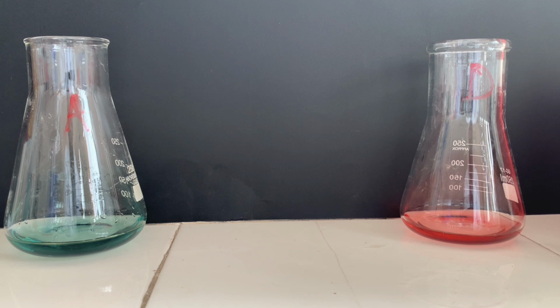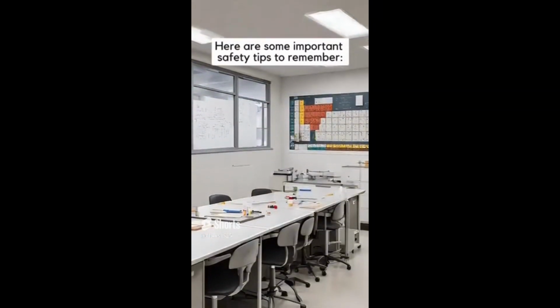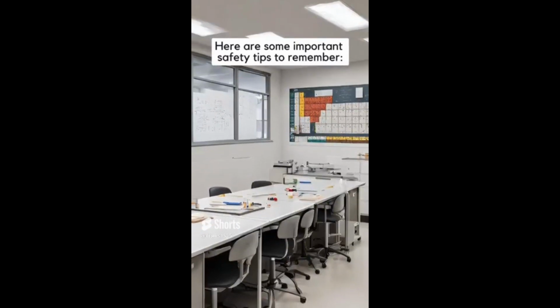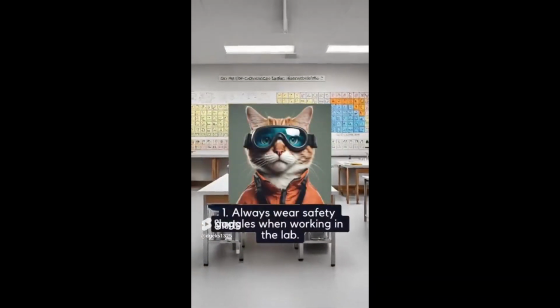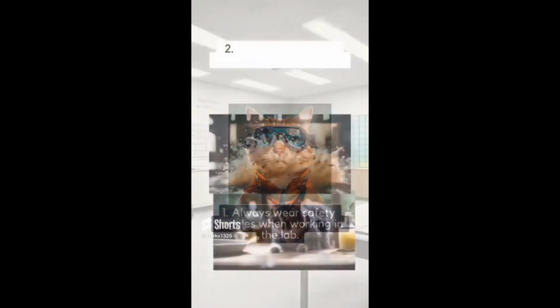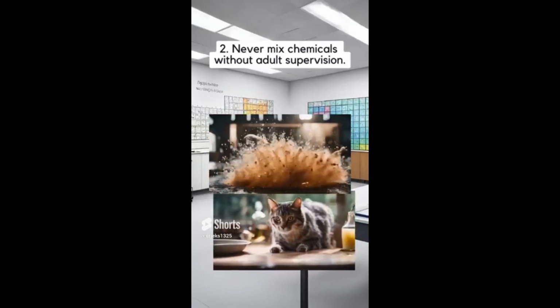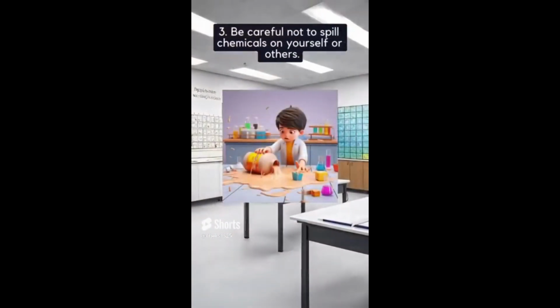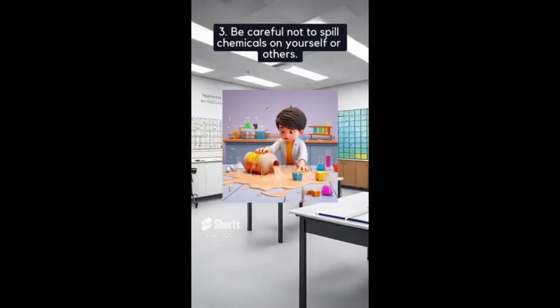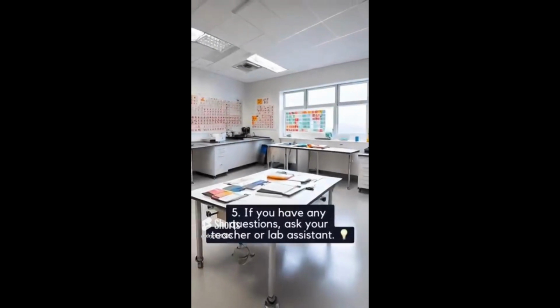Some precautions to make when you're doing this test. You notice from the beginning all our chemicals were clear and colorless. Do not test them using your tongue. Always put on safety clothing like safety goggles, gloves and everything, and the lab coat. Never mix chemicals without adult supervision, and obviously take care not to spill any chemicals on yourself or others so that you prevent accidents. Always clean up after you're done, and if you have any questions, ask your teacher.